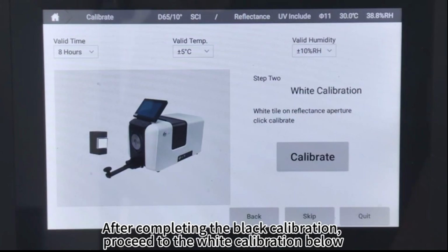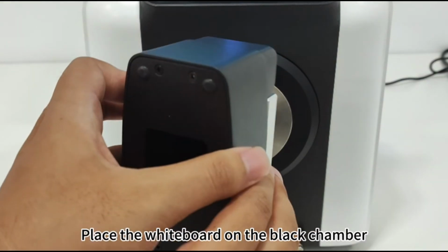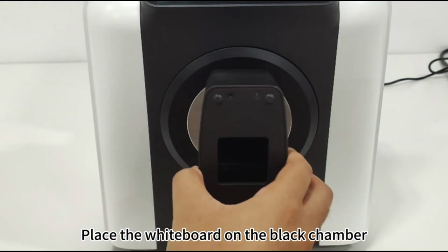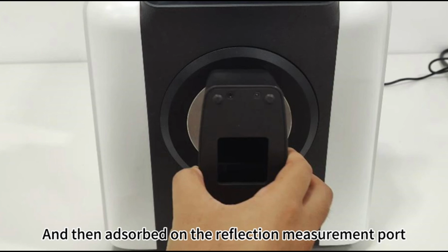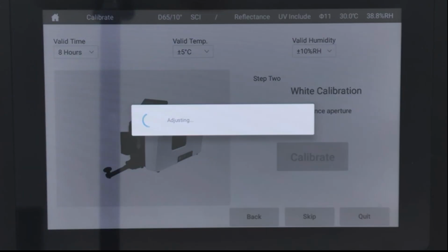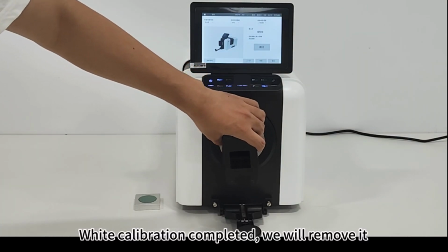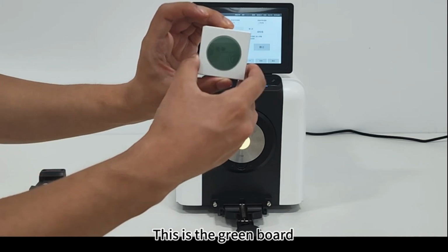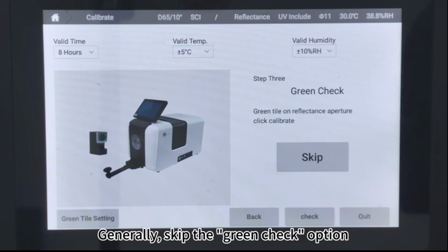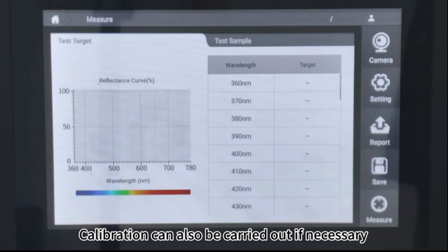After completing the black calibration, proceed to the white calibration below. Place the whiteboard on the black chamber, and then adsorb it on the reflection measurement port. Click on Calibrate. White calibration completed. We will remove the board. Generally, skip the green check option. Calibration can also be carried out if necessary.